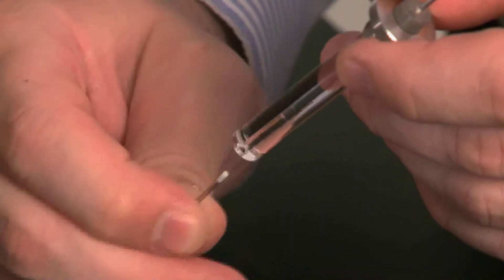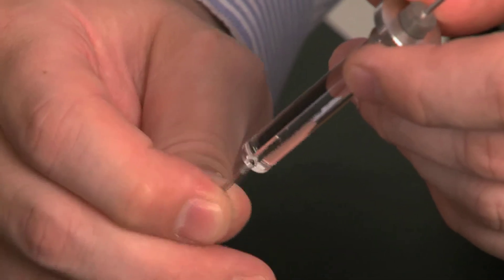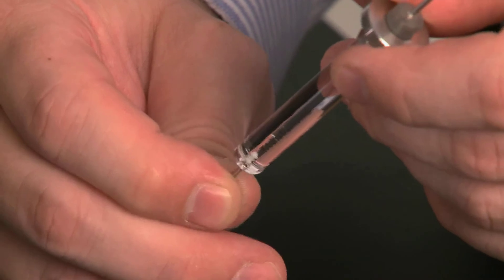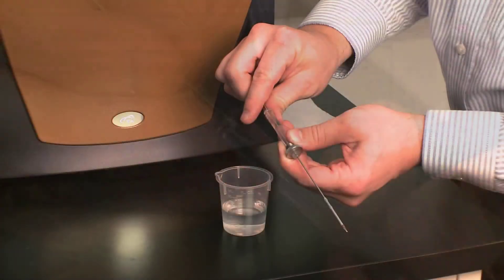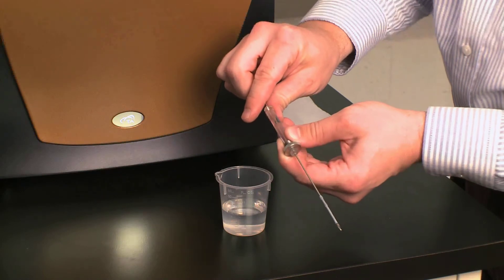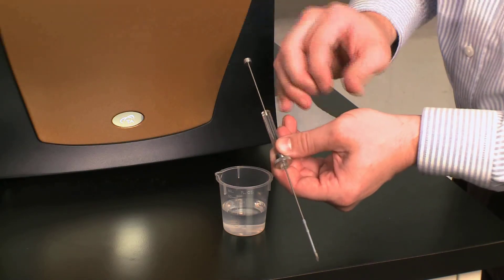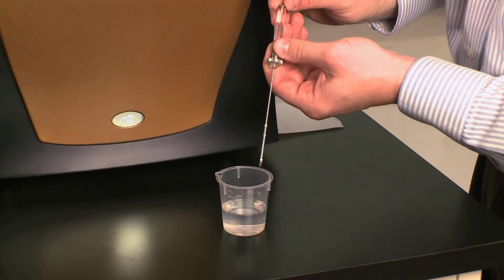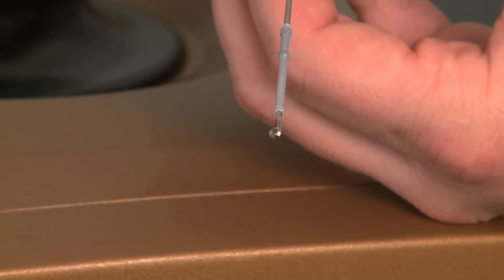And so we have just a little bubble at the end of the syringe. You see I went a little too far, so then I let it come back just so I have a little bubble right here at the end of the stopper. And what I'm going to do is then dispense until I see water coming out of the tip.